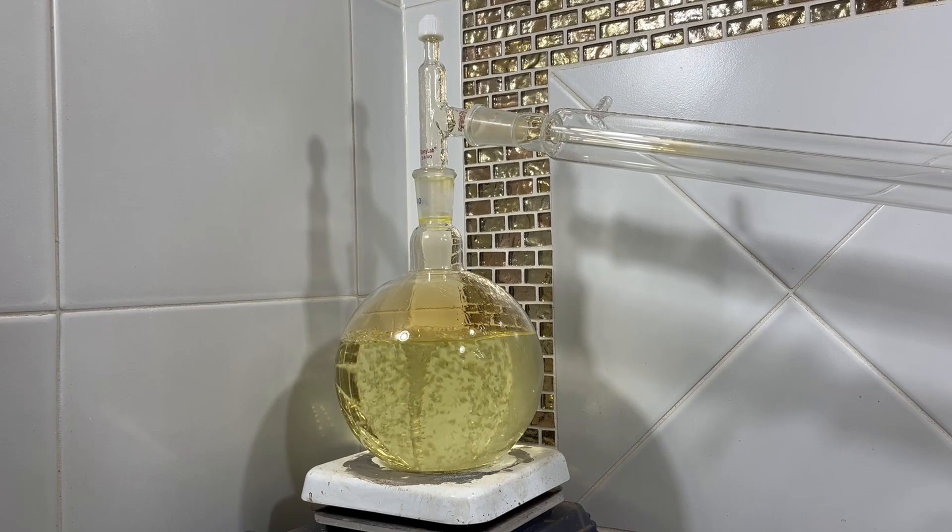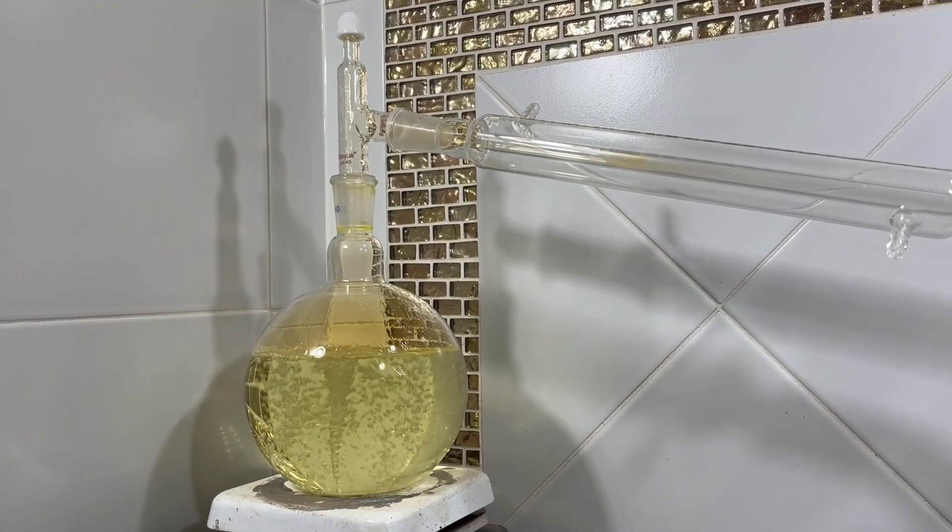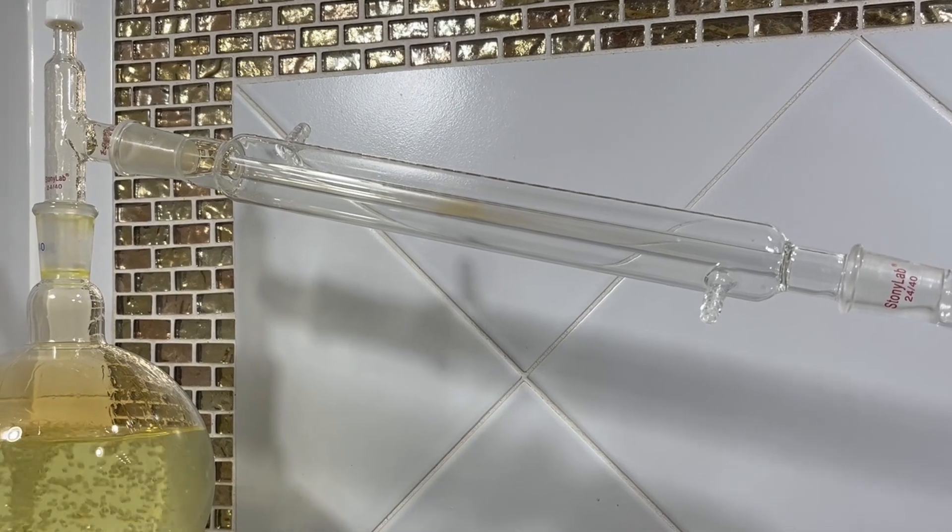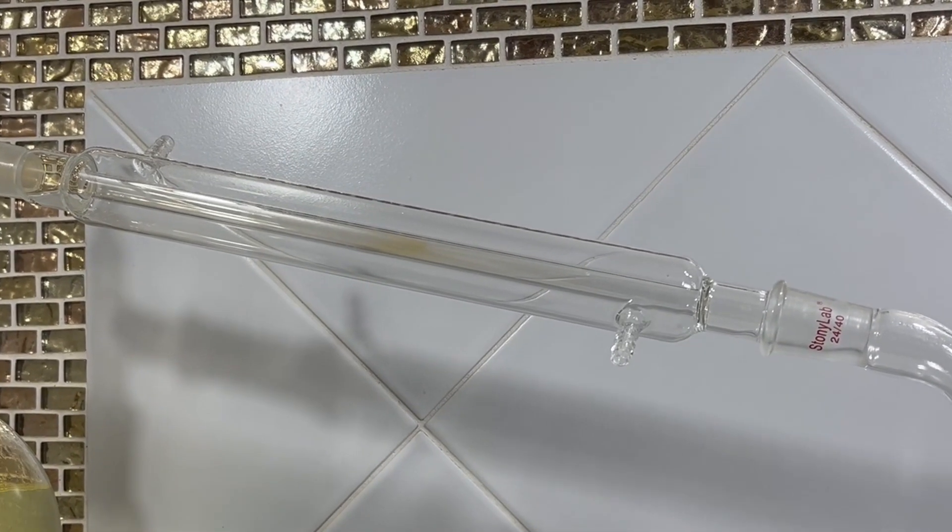Here's a great look at the moment the nitrogen dioxide starts to flow down the condenser. The first step in nitric acid formation.